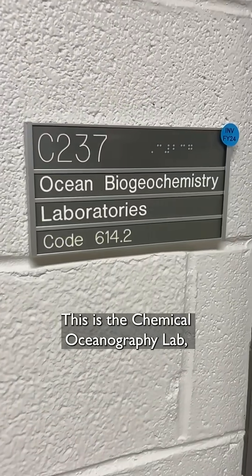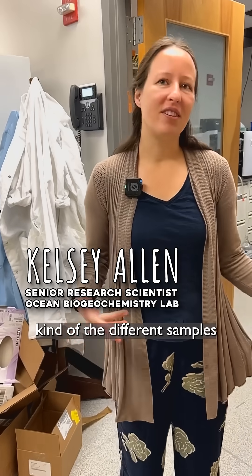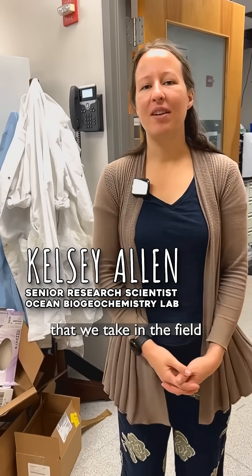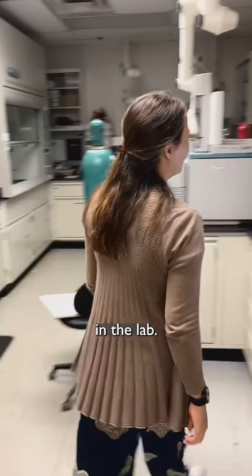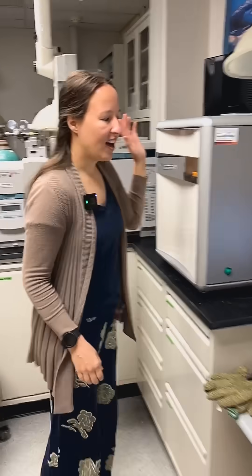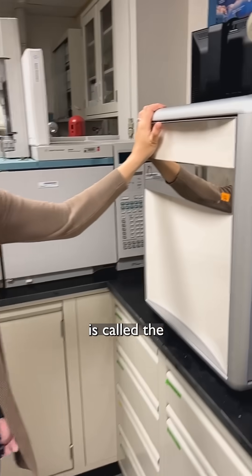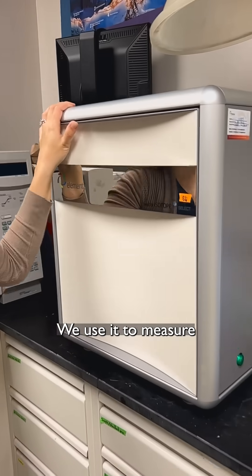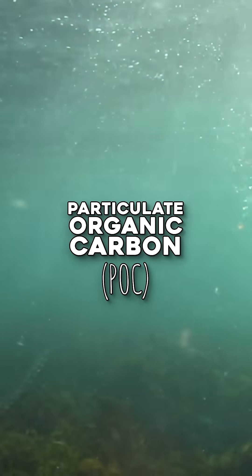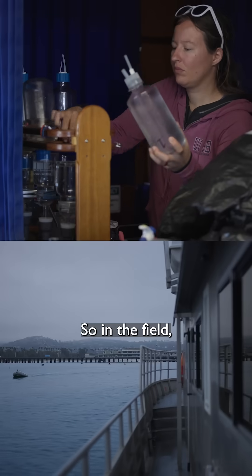This is the Chemical Oceanography Lab and I'm going to show you guys around the different samples that we take in the field and how we analyze them in the lab. This instrument is called the Elemental Analyzer. We use it to measure particulate organic carbon.